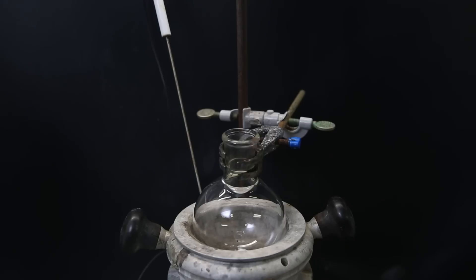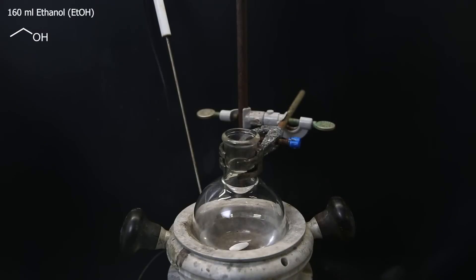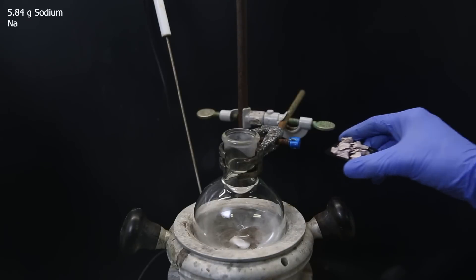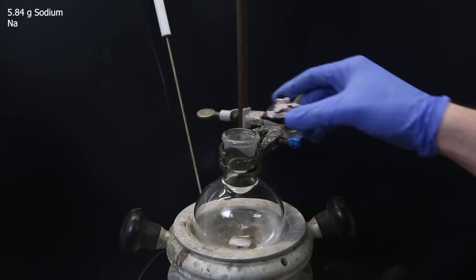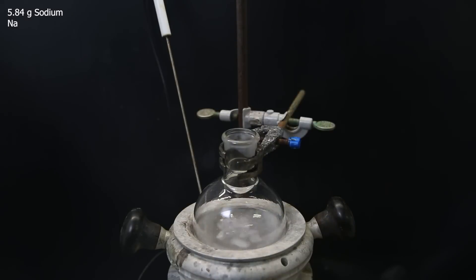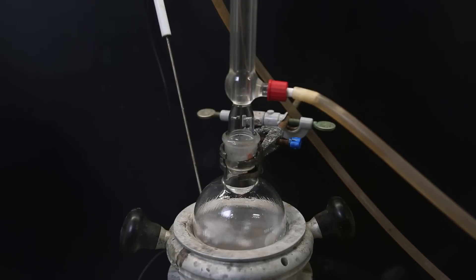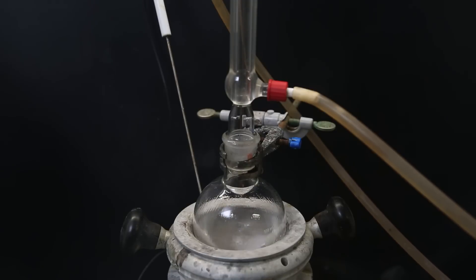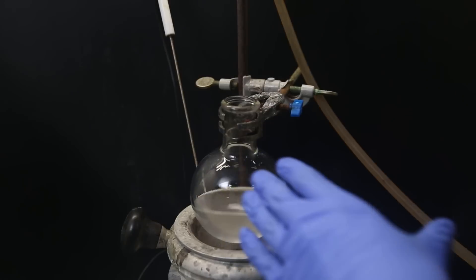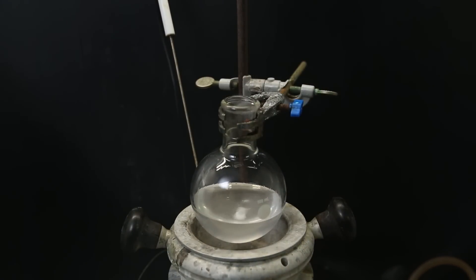Now I set up a new flask with a stir bar and add in 160 ml of ethanol as a solvent and reactant. I then gradually add in 5.84 grams of metallic sodium, which immediately starts reacting to form sodium ethoxide and hydrogen. I heat the mixture to a reflux to make it go faster, and when all of the sodium has disappeared, it is finished and I take it off heat, leaving us with a solution of sodium ethoxide.